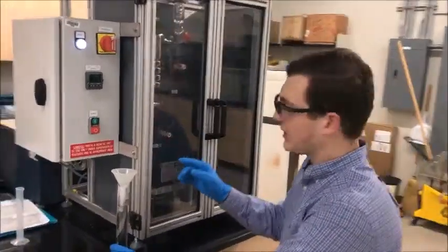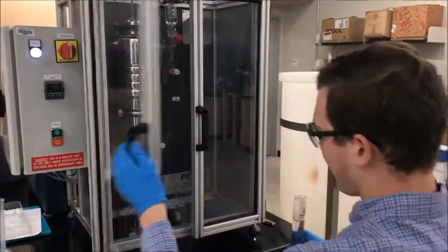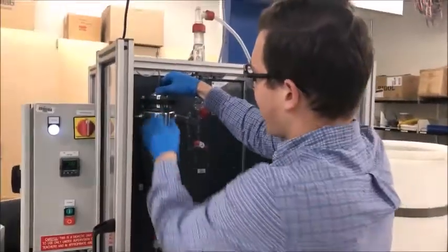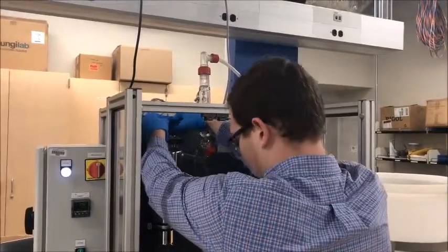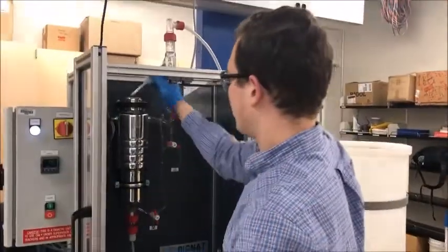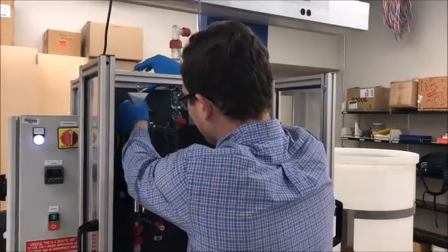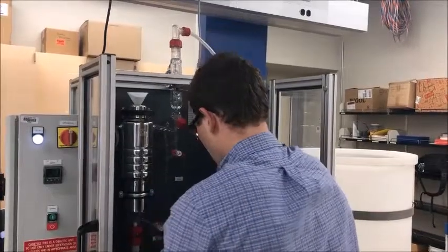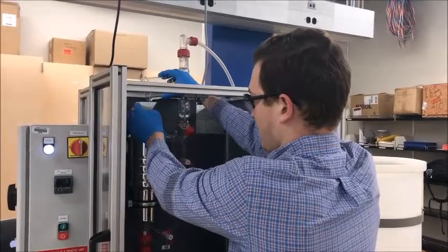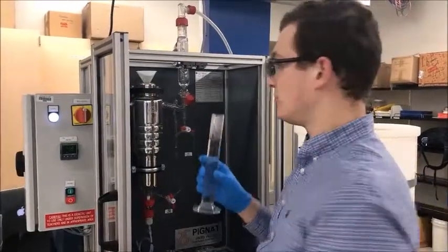Once our system has stopped bubbling, and we can see it through the slit on the glass in the front, we can then open the apparatus back up and unscrew the thermocouple at the top. Once this is unscrewed, we use a funnel to then recycle our previous streams and to add the water to continue diluting our solutions.